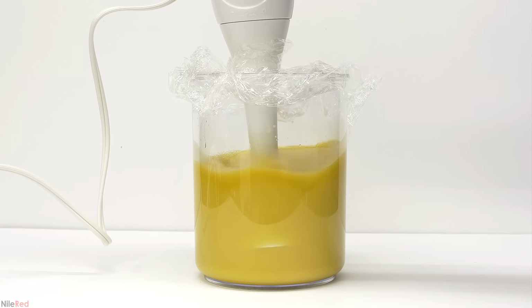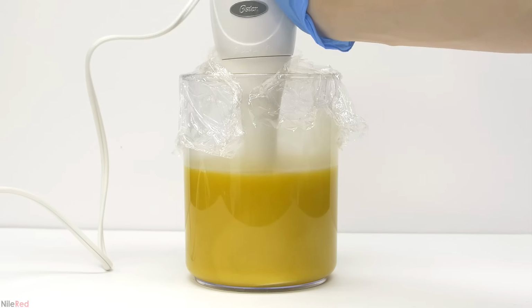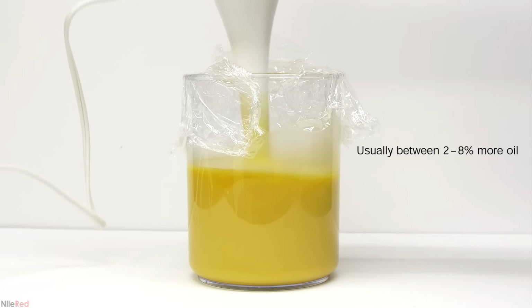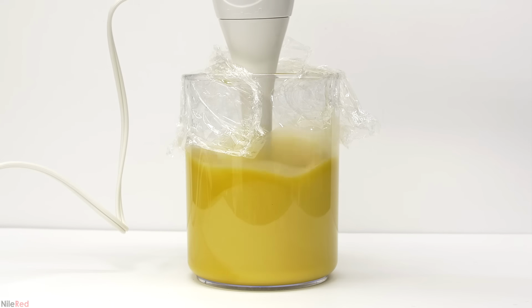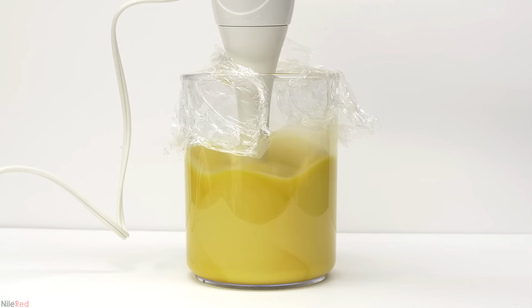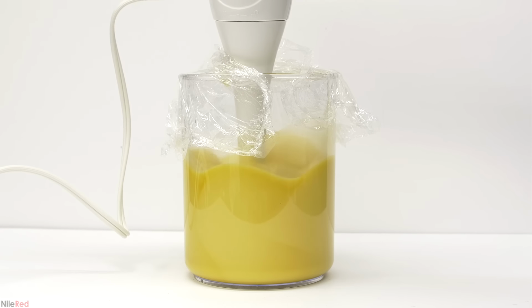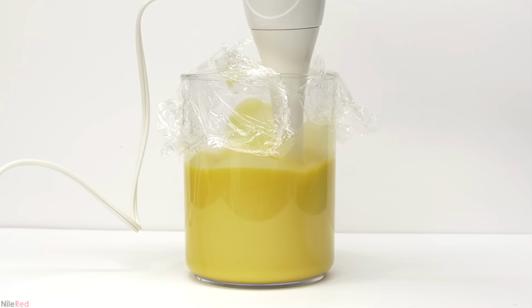When making hard soaps, it's very important to use slightly less sodium hydroxide than is needed to completely saponify all of the oil. Sodium hydroxide is consumed in the reaction, and we want there to be little or none left in the end. Otherwise, it can sometimes be irritating to the skin. Also, leaving a little bit of extra oil in the soap will make it softer on the hands and less dehydrating. This idea of using more oil than is needed is generally known as superfatting. Because this is all done cold, the reaction is quite slow and takes around 2 weeks to be complete.